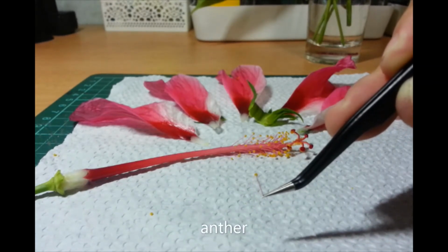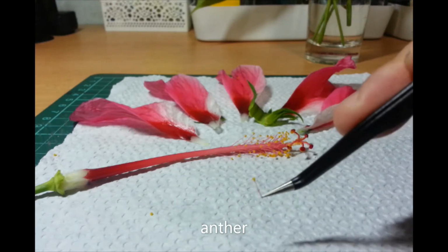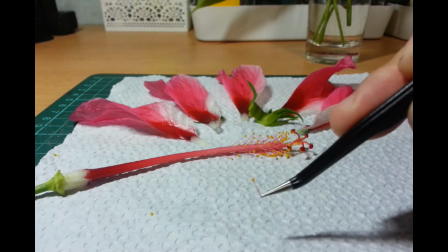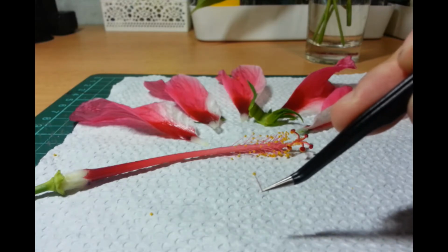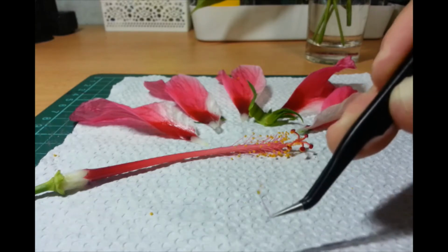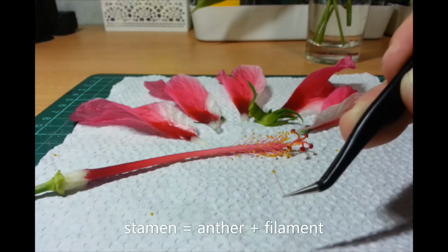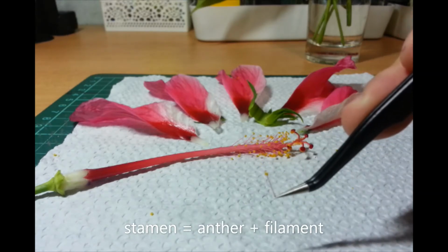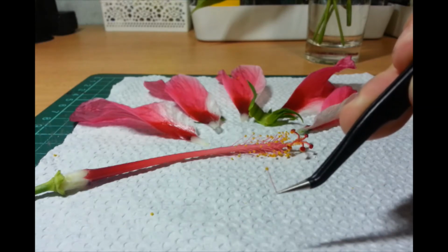So, dyan mo makikita yung pollen. Okay? Dun sa, kita nyo yung yellow na bulbous part sa tip. That is the anther. Okay? And the filament is the stalk. This is collectively called the stamen. This is the male part. Okay? So, dito, sa loob ng pollen, kasi doon pinoproduce yung male gametes. Okay? So, kaya yung pollen ang nagfa-fertilize.